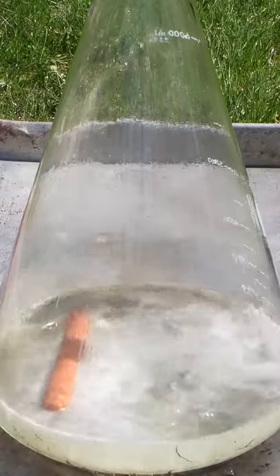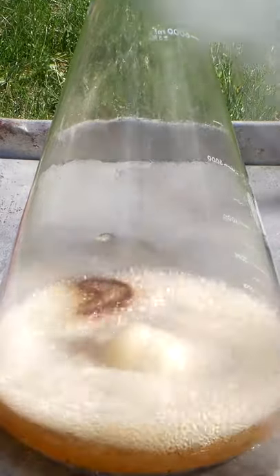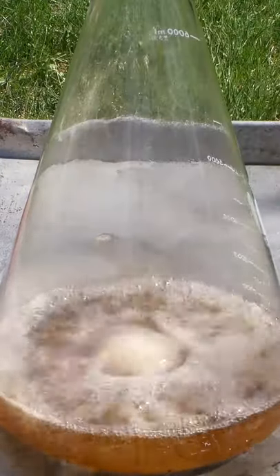I also did it on a much larger scale, and I was able to dissolve an entire hot dog, which was kind of terrifying.